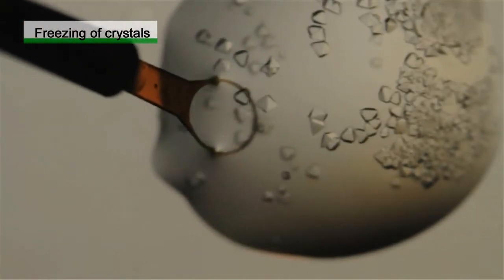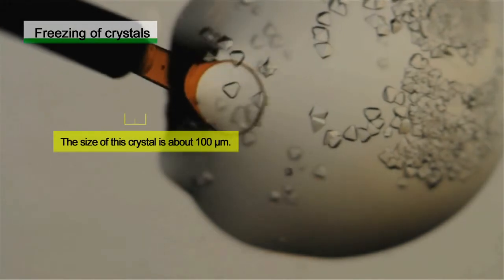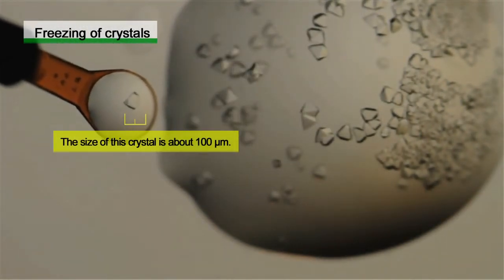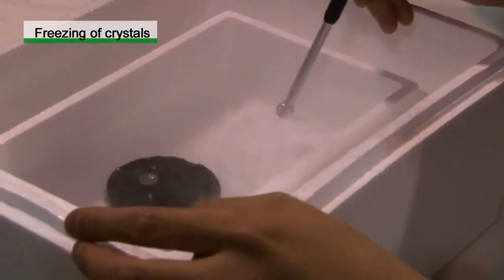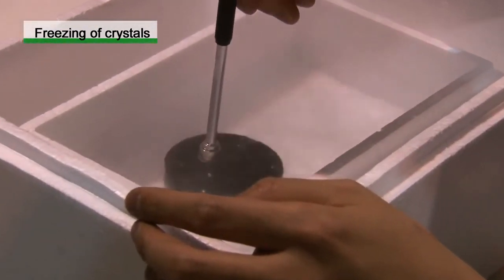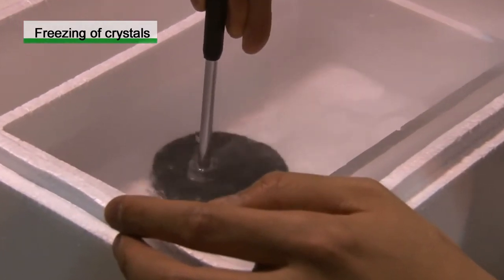After crystallization, preparation for a diffraction experiment is necessary. Firstly, a crystal is scooped with a resin loop. Next, the crystal is frozen in liquid nitrogen and packed into a cassette for the automatic sample changer.